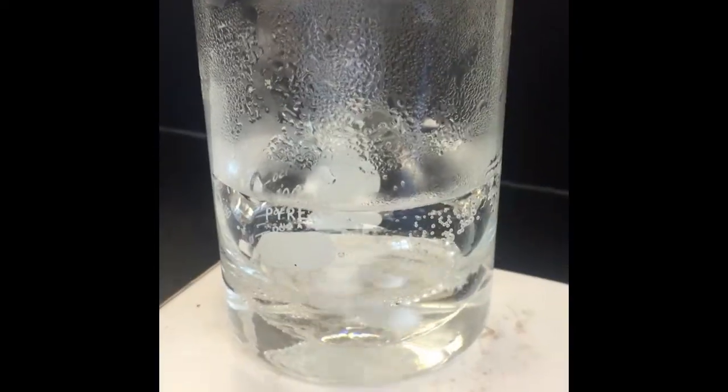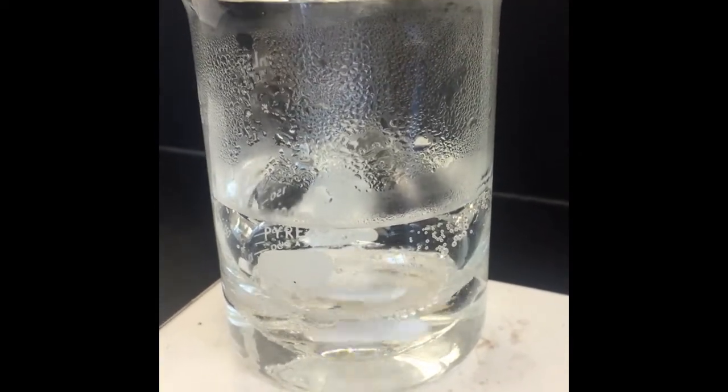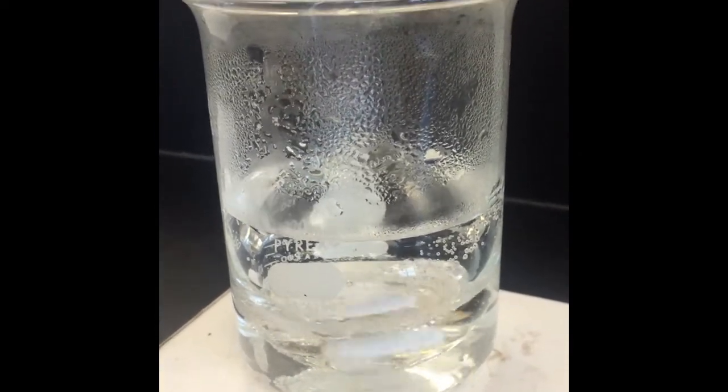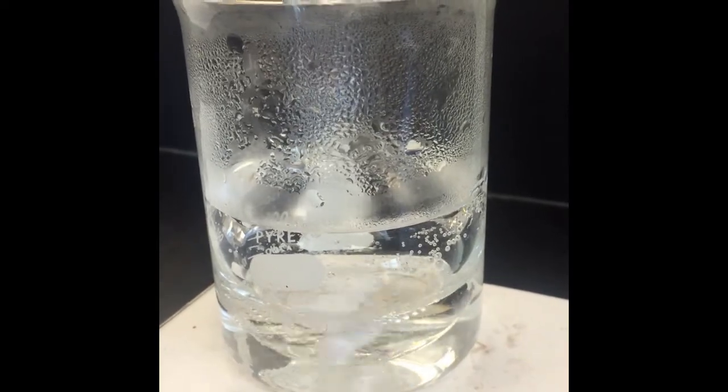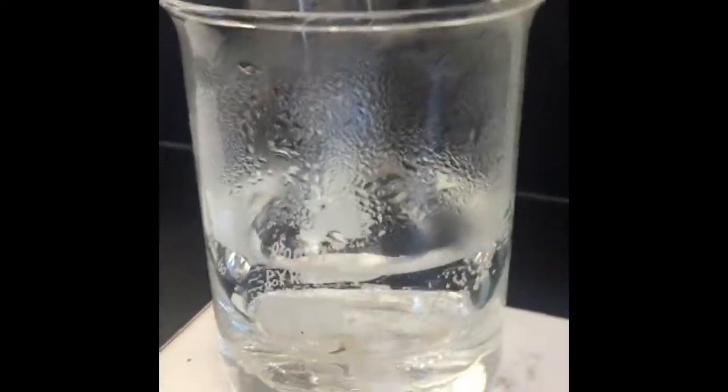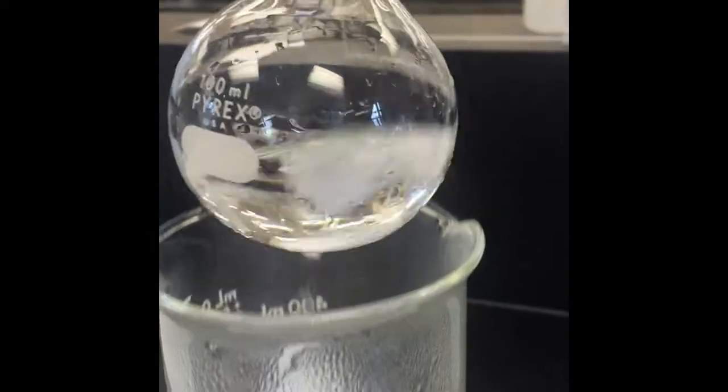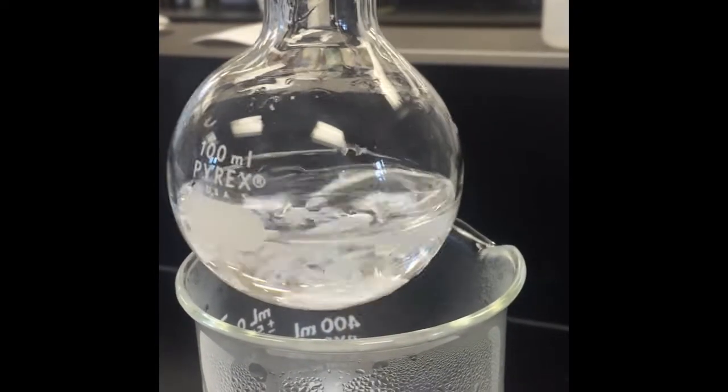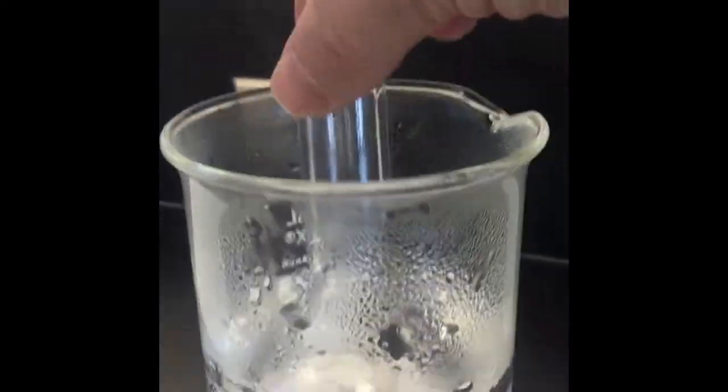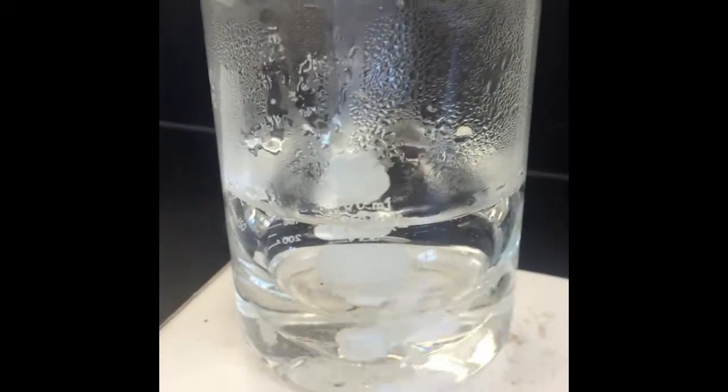So now our hot water bath has reached boiling. Most of that solid has dissolved. There's still some left but we'll let that sit and stir in the boiling water bath for a while and see what we get. We'll give that half an hour.